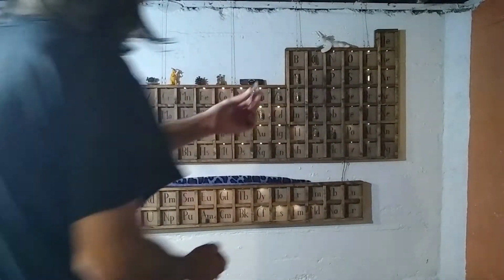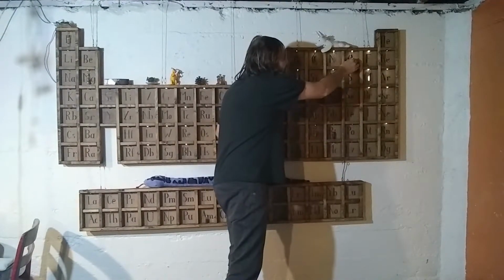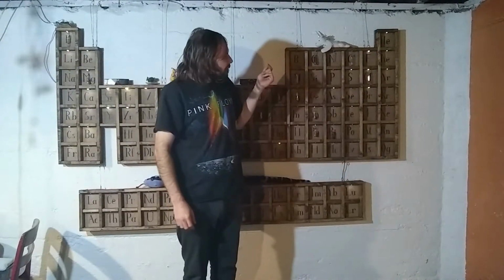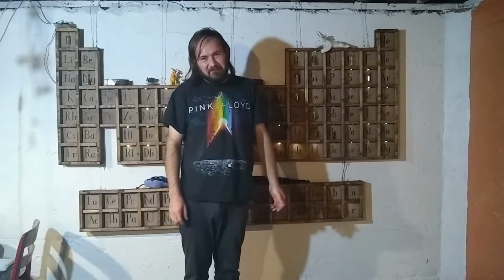A vial of oxygen for my table. And what a pain in the neck this was. 4 times remaking that vial. And even after that, this one still failed about 20 minutes after I sealed it.